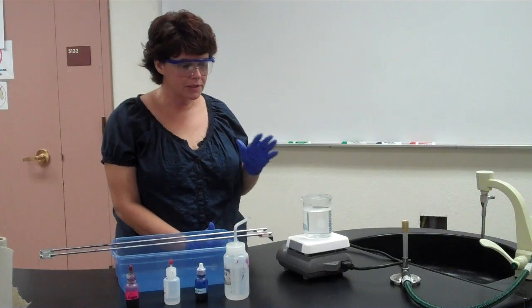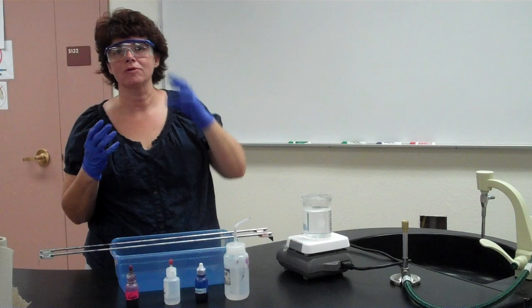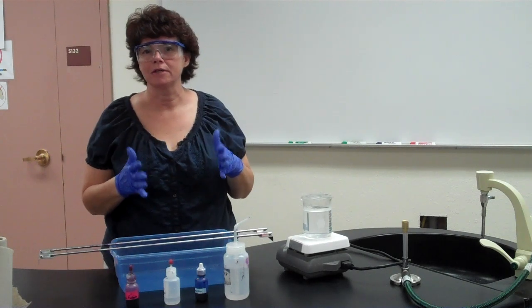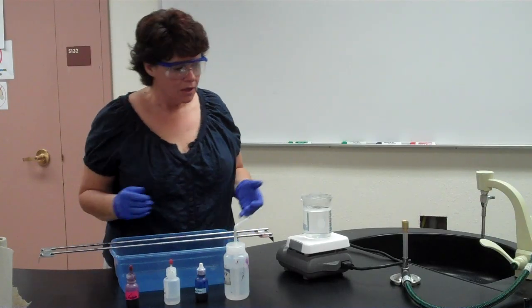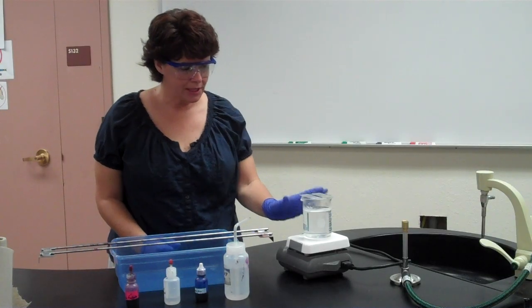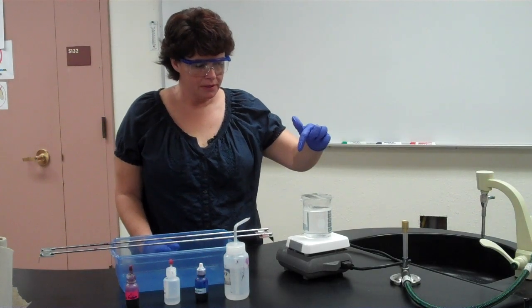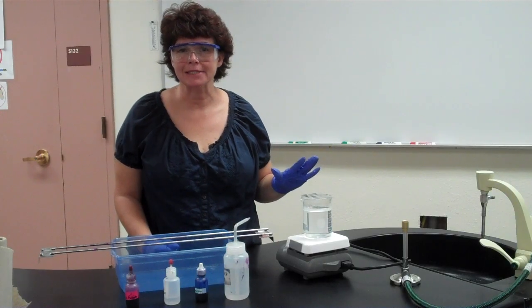The reason that we're going to use steam is because that mycolic acid is so resistant and so thick, it's a waxy coat, that we want to kind of soften it a little bit to allow the stain to penetrate. So the method that we're going to use requires the steaming. And you'll notice I have the beaker with the water there already. You want to put the smears that are fixed on the beaker before you add any stain.